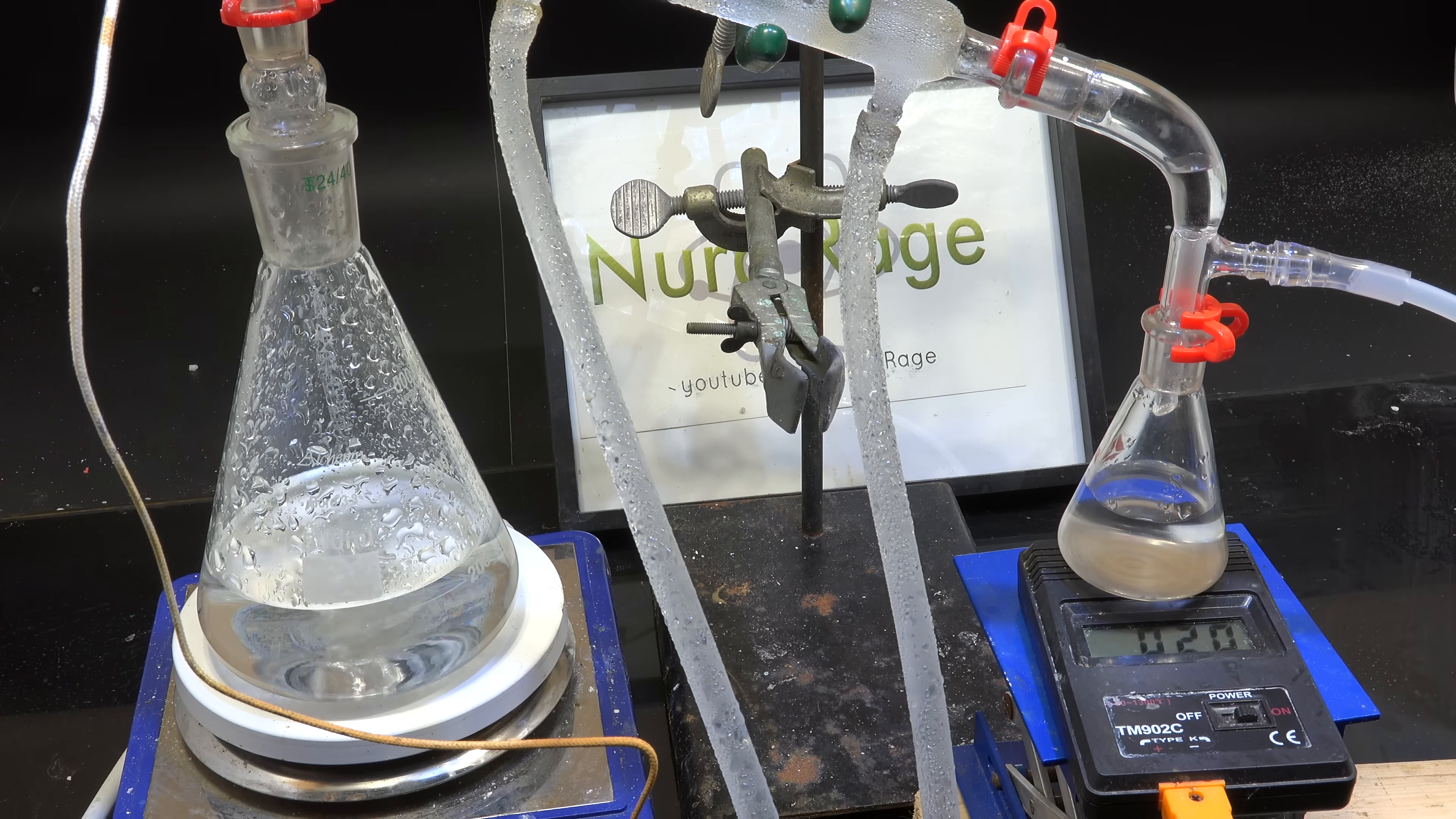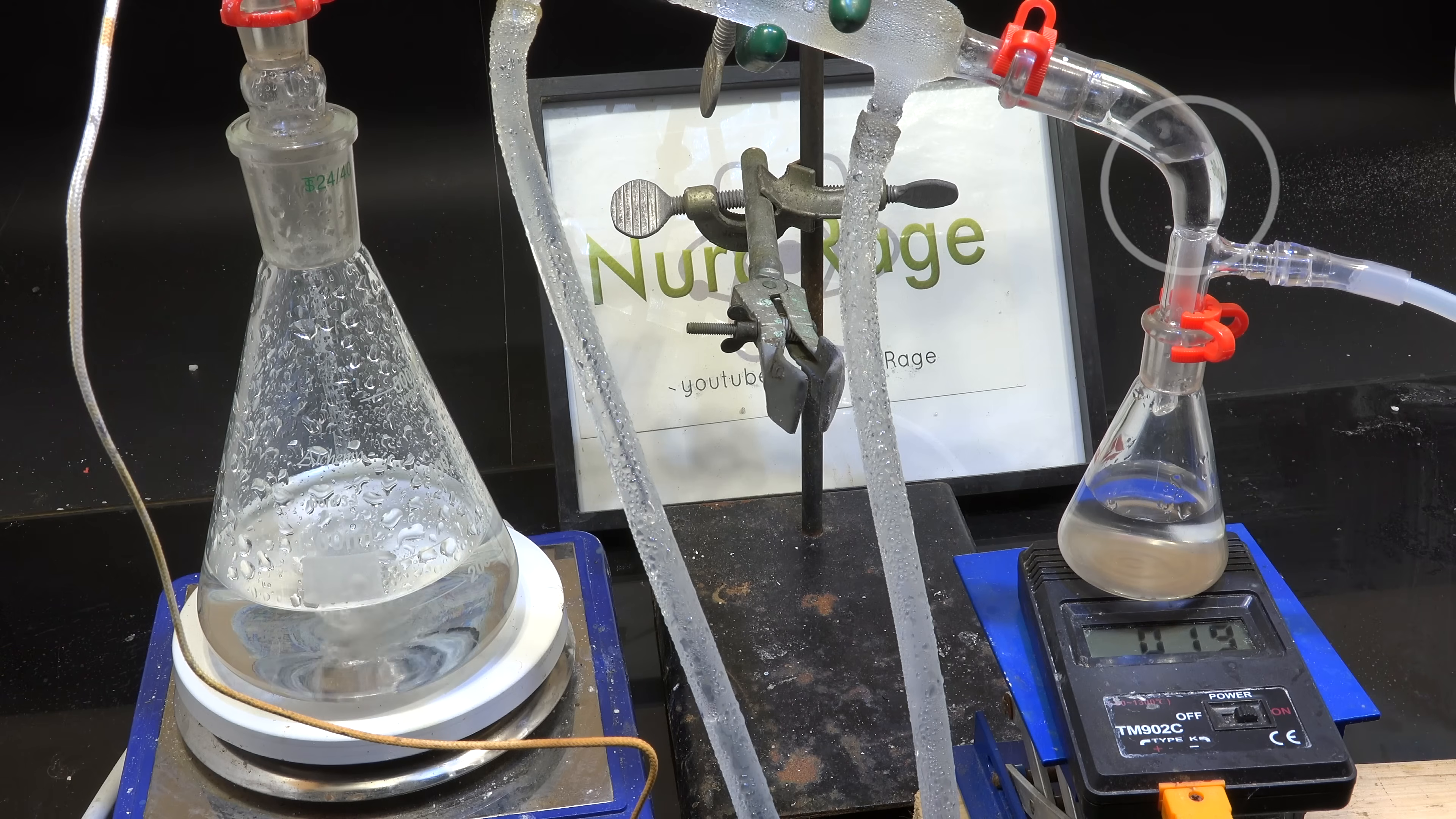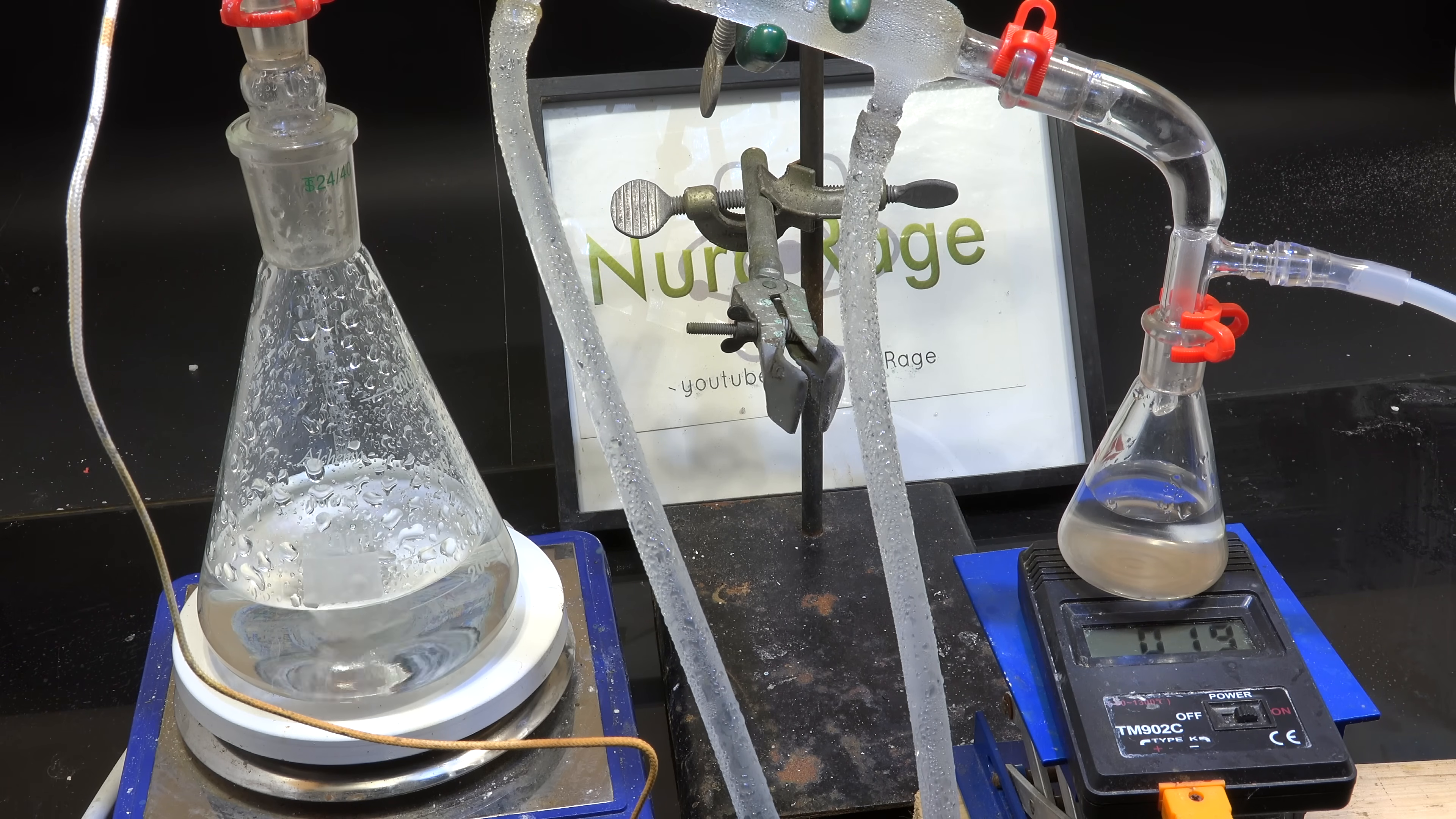Okay looks like the vacuum has improved considerably. You can see here water is actually getting trapped in the vacuum adapter. The pressure is so low it can no longer push the water through. We've reached 19 degrees celsius in our distillation.